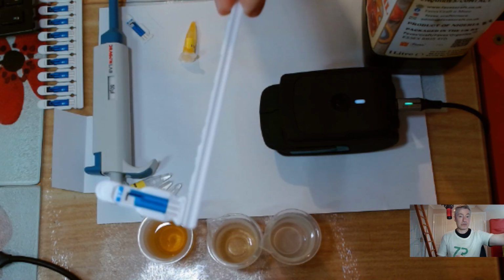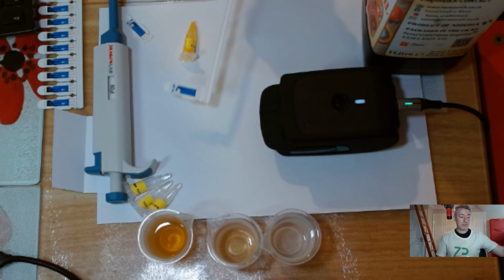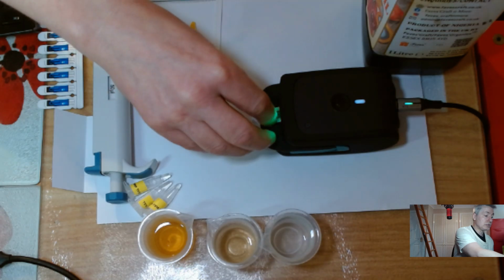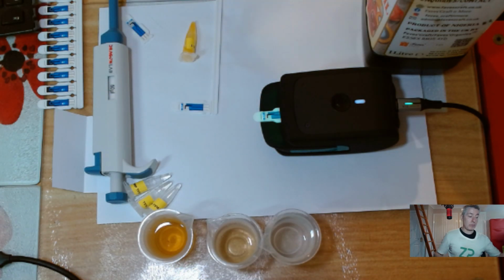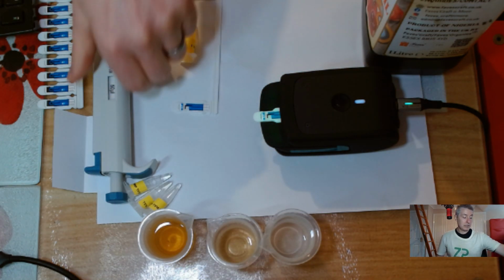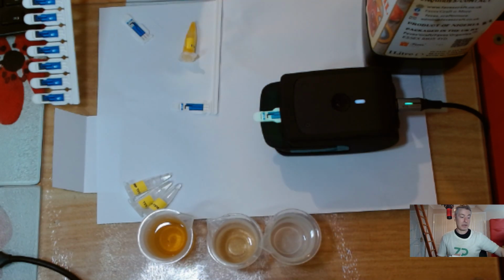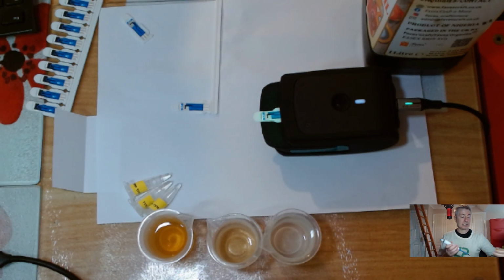This is the hypervalue carbon electrode. I'm going to use just the rectangular one because I'm more familiar with it. But if I was doing an academic program, I'd probably be using the circular ones because they're easier to pipette onto. Anyway, with that said, let me grab a sample.